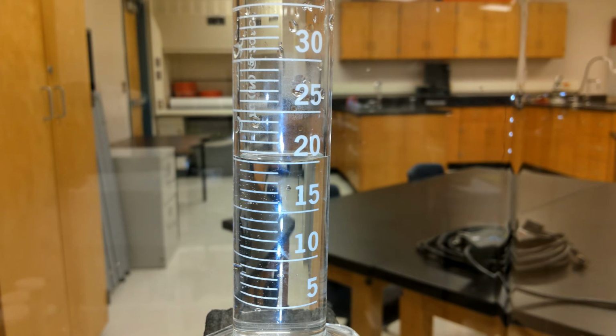Okay, for the next procedure, I placed 20 milliliters of water in a graduated cylinder. Then I'm gonna add glass samples taken from Brian's car to the water in the graduated cylinder. You're gonna read the new volume on the cylinder in milliliters and record it on your data table. So again, this is Brian's car.